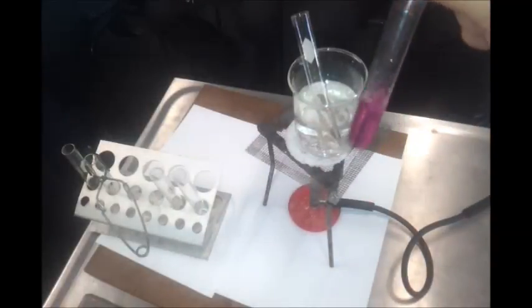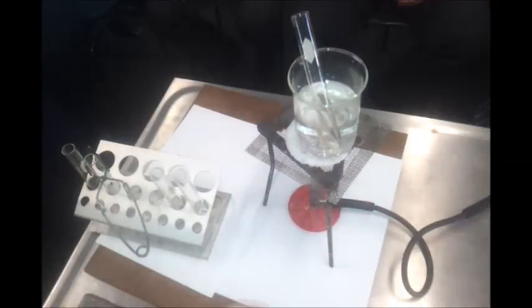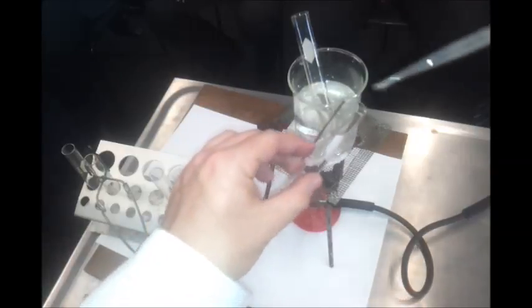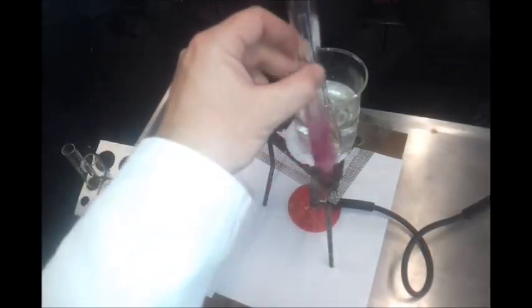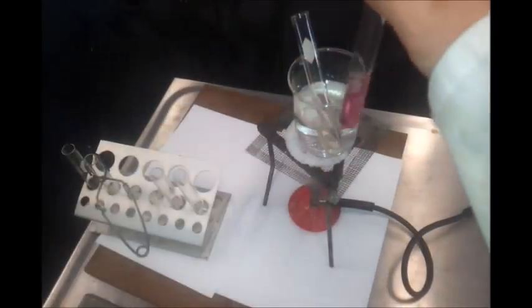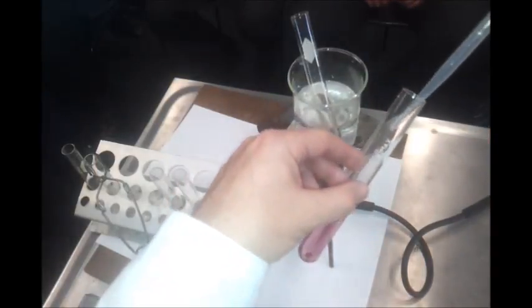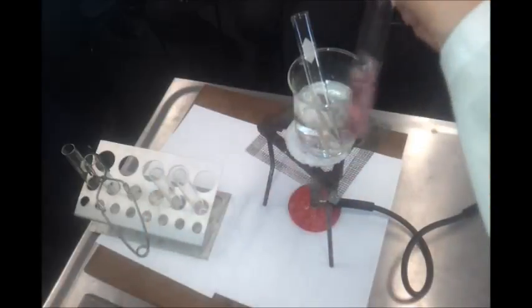But we can see that the colour's faded. It's not just diluting. I'm going to add a little bit more ethanol because I have actually done that the wrong way around. Not that that's too important in this case. It will be in the next one, though. So if I have ethanol in there, it starts to decolorise it. I've used way too much of my potassium permanganate, which is why it doesn't seem to be doing a lot other than diluting the colour.